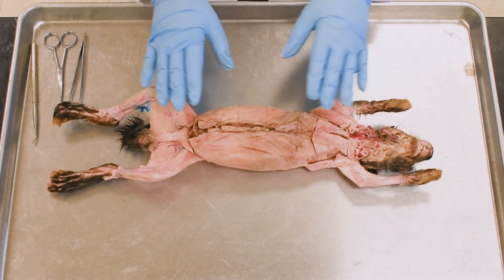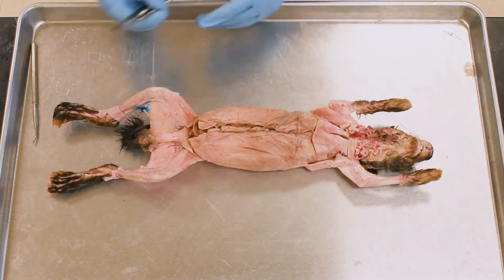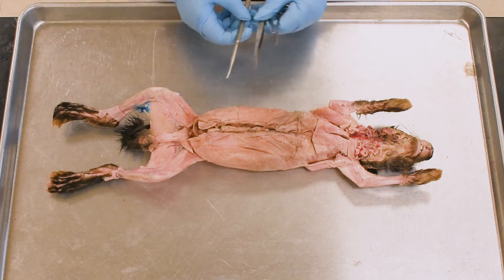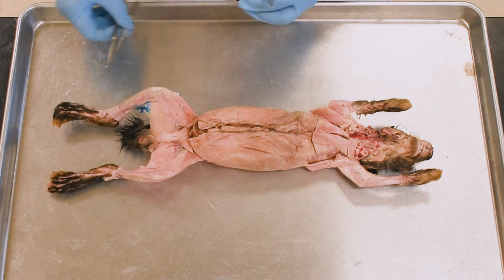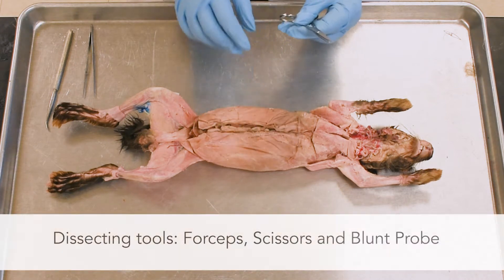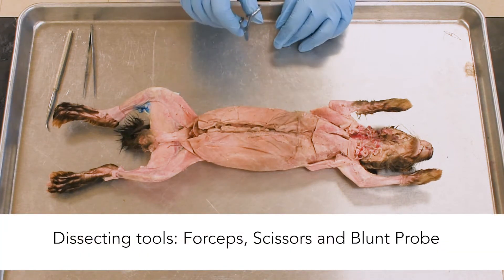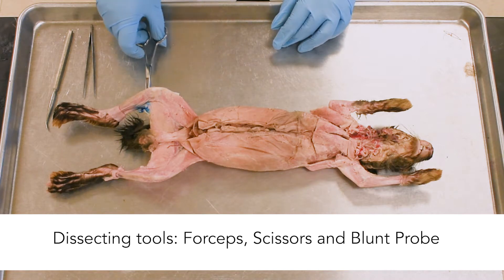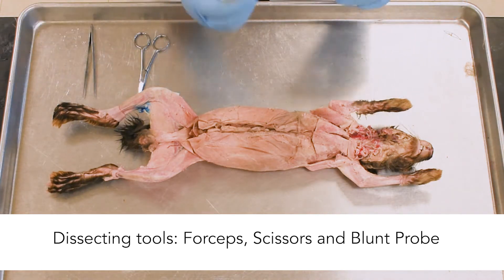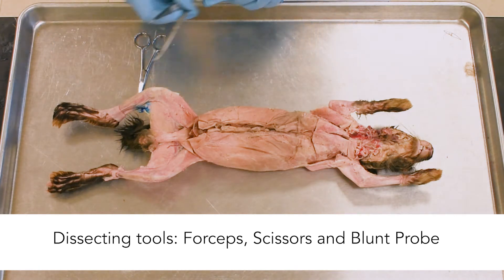Once you start with the rabbit, you will need the tools: the forceps, the scissors, and the blunt probe. Except for opening the body cavity or sometimes cleaning up the muscles, try not to use the scissors, otherwise it might damage the blood vessel. We will be using the blunt probe mostly and the forceps.